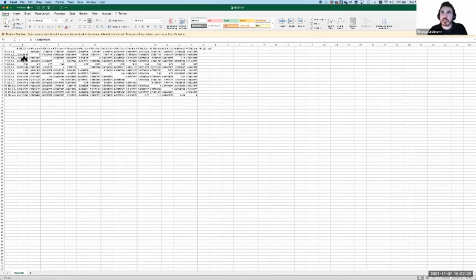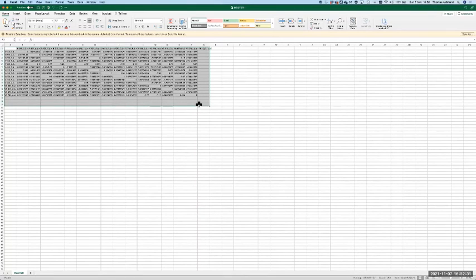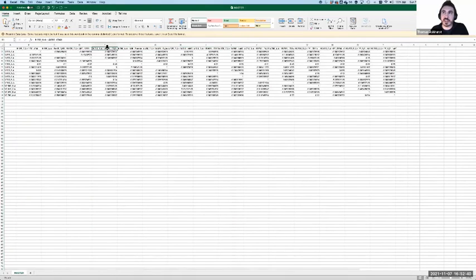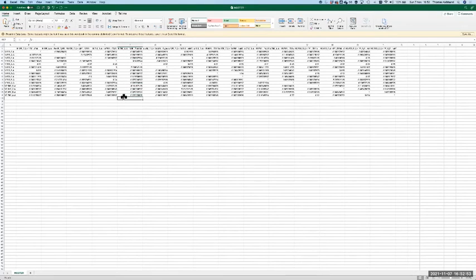If you make a matrix, you can export it as a CSV file, and it just looks like this. Because the naming is fairly formulaic, for detector assignment, stain name, parameter assignment, I'm pretty sure you can force it. So you just put a column in there, give it the same name as the detector, and import that into Flowjo, and then you'll have that column. But it won't have the contribution in it. How the heck did I get around this before? Because I had to do this.